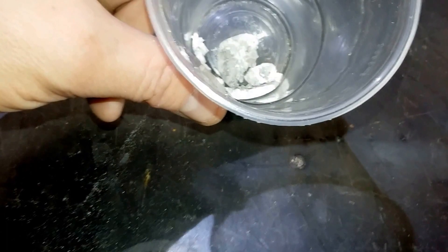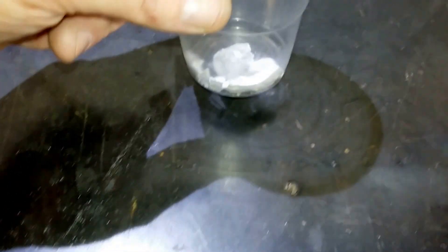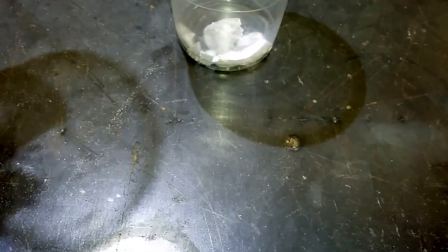And it's made a very unusual alloy that actually crumbles very easily in your fingers. So I'm going to try adding some water to this and see if this reacts any differently.